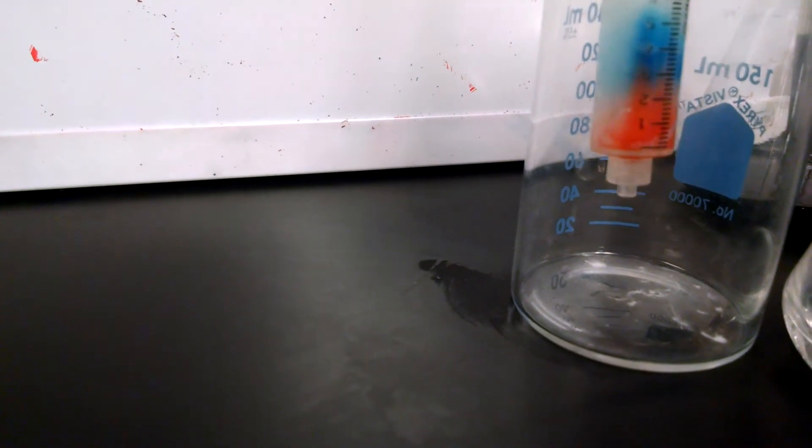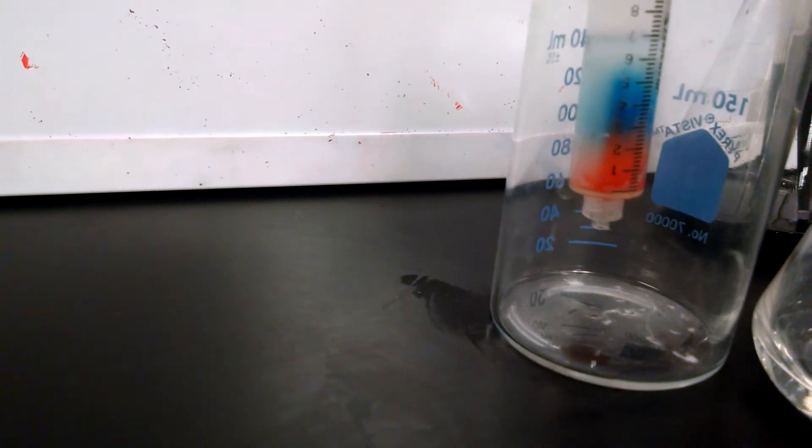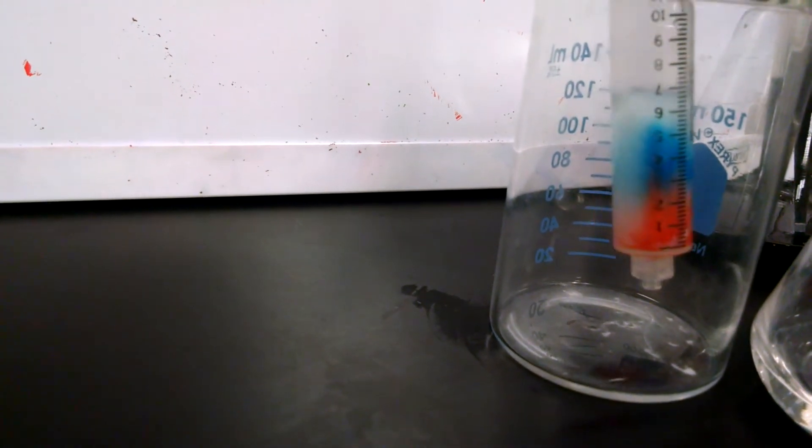I'm going to push it some more. There you go. I'm going to pause the video and allow that separation to happen and you'll see what it looks like in a minute.